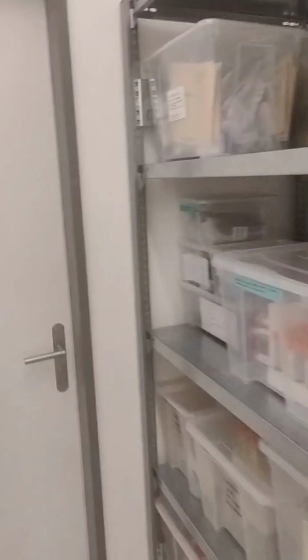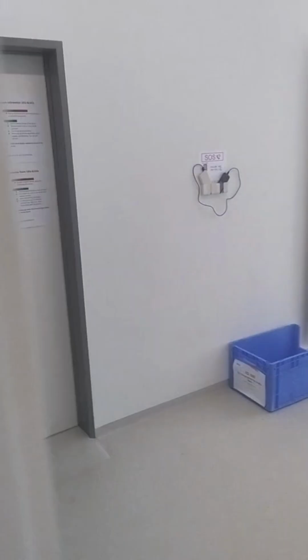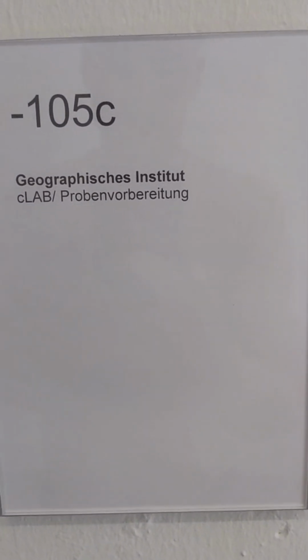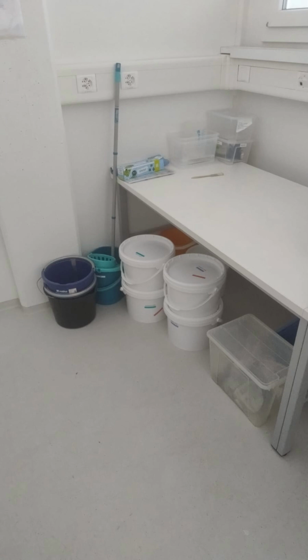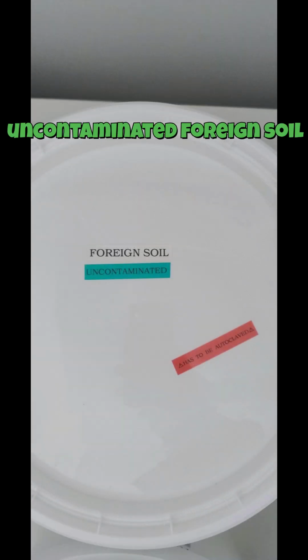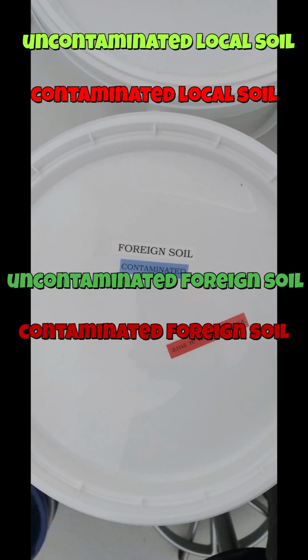So, as the last part of this tutorial, let's take a look at how to properly dispose of soil samples. Soil disposal takes place in the sample preparation room. That's room -105C. In total, there are 4 white buckets, and every soil sample needs to be assigned to one of these 4 categories. These are uncontaminated local soil, contaminated local soil, uncontaminated foreign soil, and contaminated foreign soil.